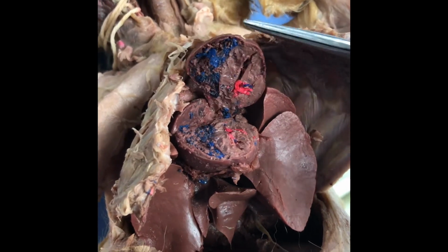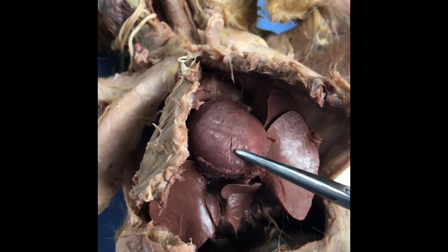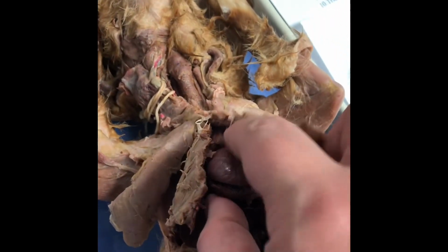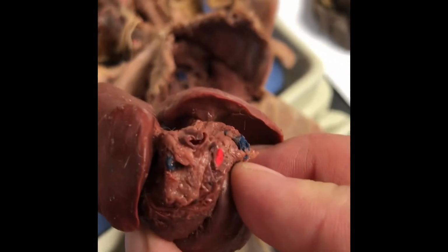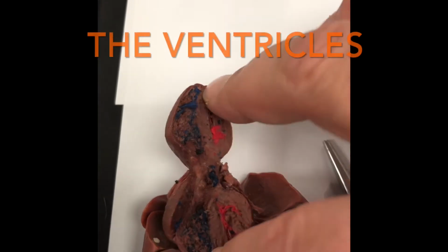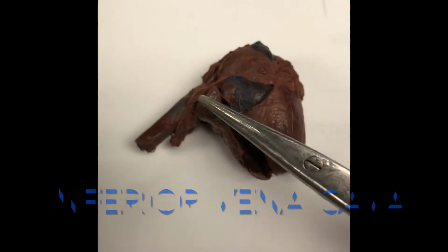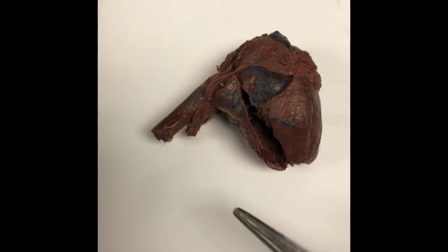So you can see the inside of that, and the septum was in the middle, so I'm closing the heart there. You have the heart, the lungs on each side. This is the ventral aspect of the rabbit. So I went ahead and took that out so that you could see the aorta coming at the top. That's in red. The superior vena cava is dyed blue. Here's the inferior vena cava right there going off the bottom of the heart.